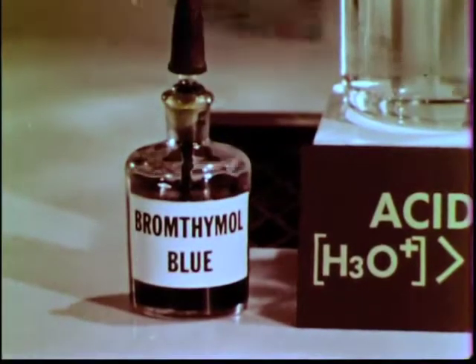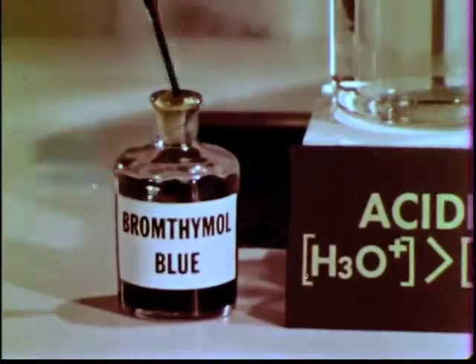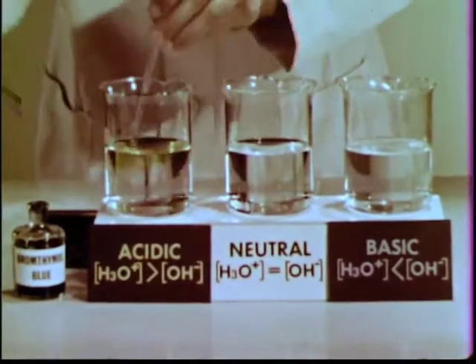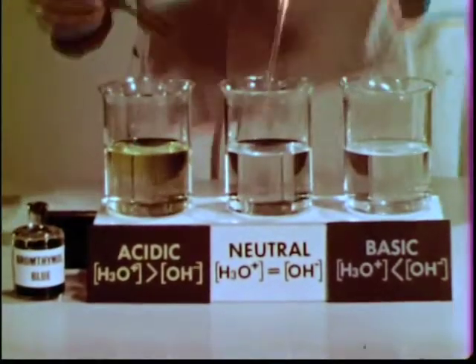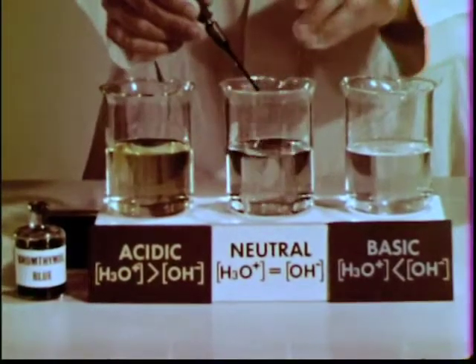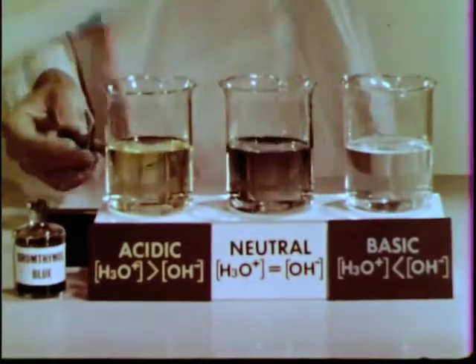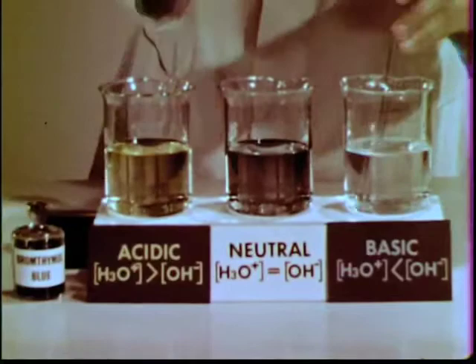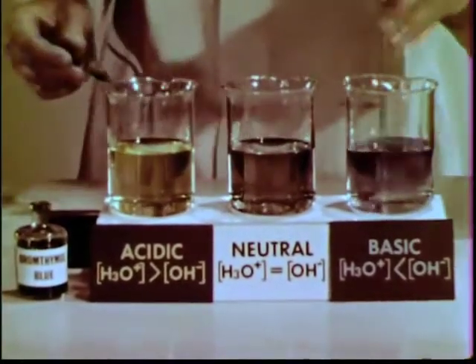Now let's add some of the indicator bromothymol blue to our solutions. We see that the indicator is yellow in the acidic solution. The indicator is blue in the basic solution and an intermediate color in neutral water.